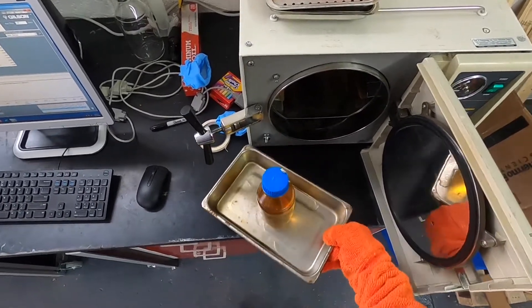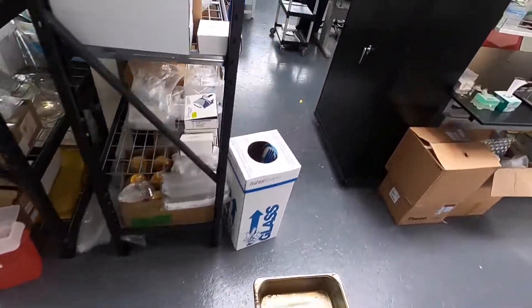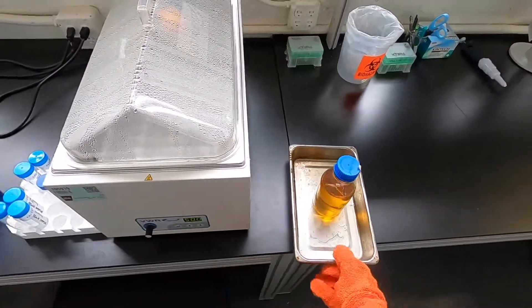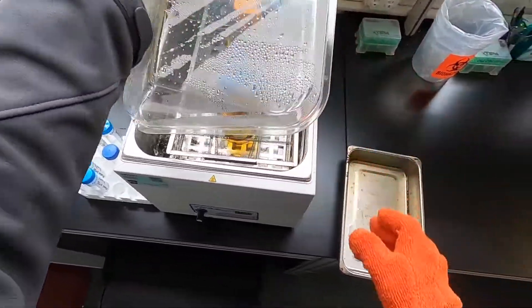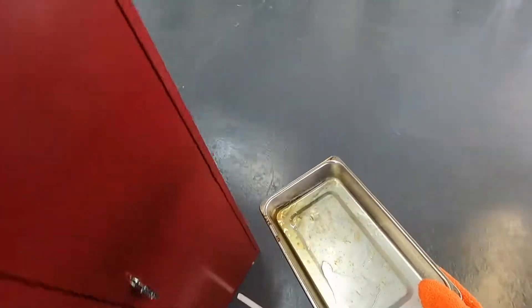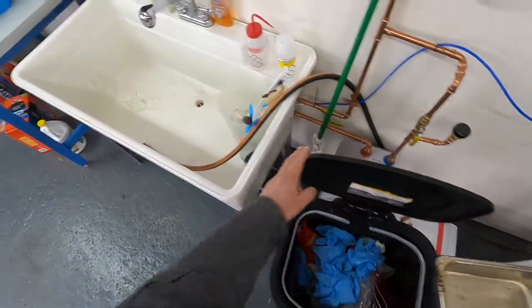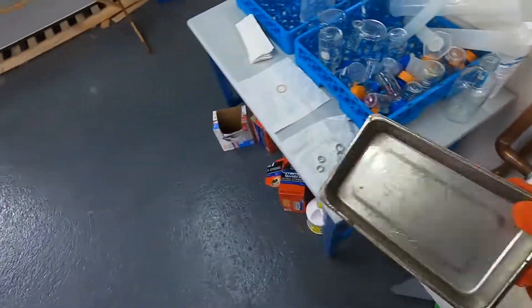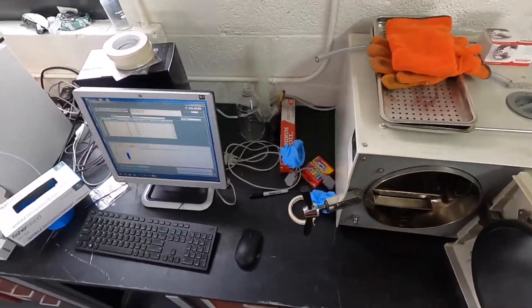After it's cooled a bit, put in a 50 degree water bath and rinse out the agar so it doesn't solidify like that.